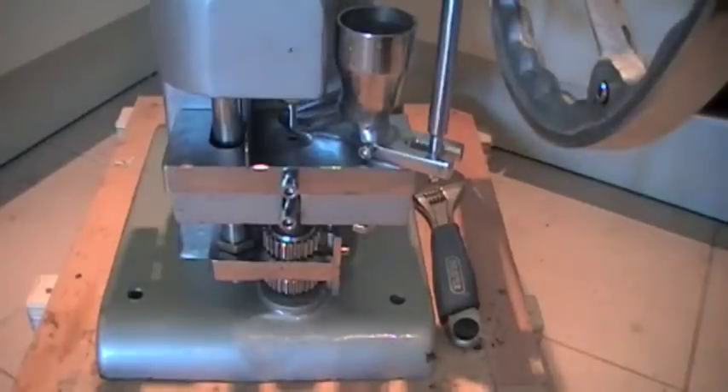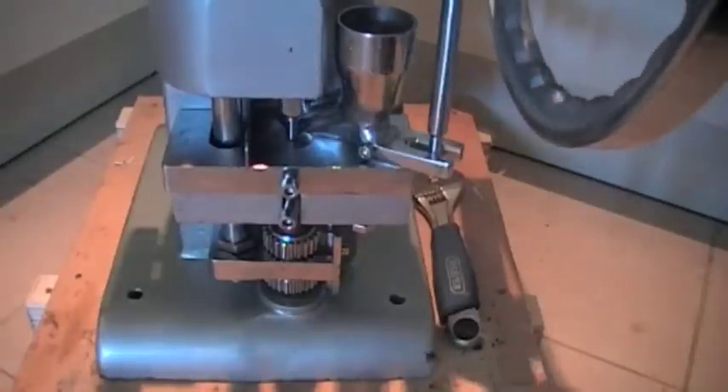Hello and welcome to the London Fashion Arts video on how to adjust your dies. Today I'm going to show you how to adjust the dies — both the fill depth and the ejection depth — for the TDP range.